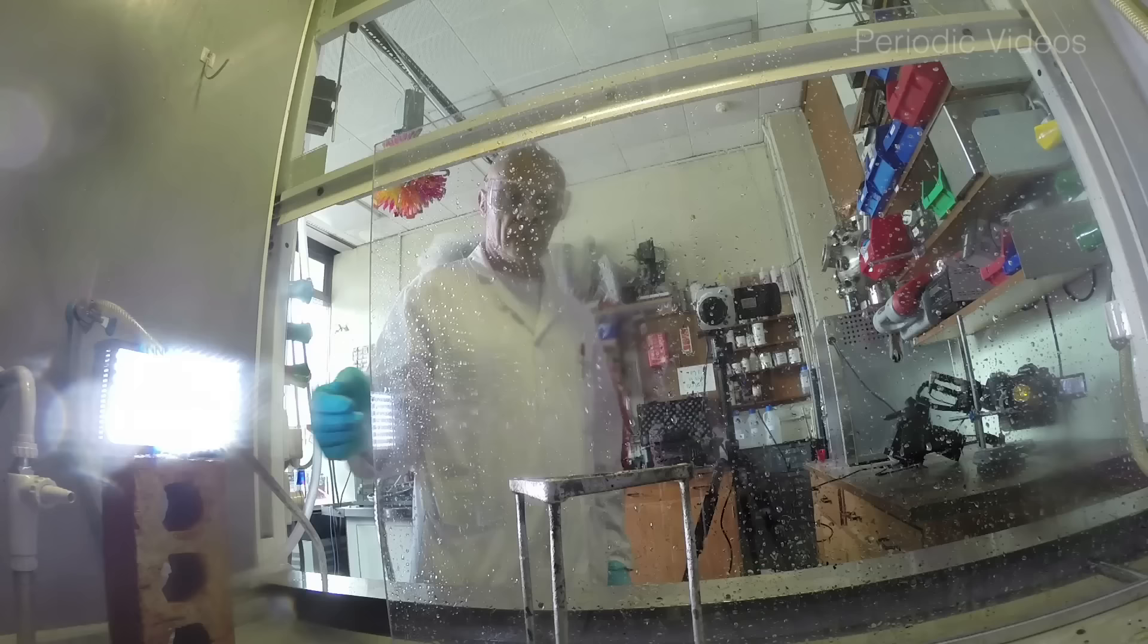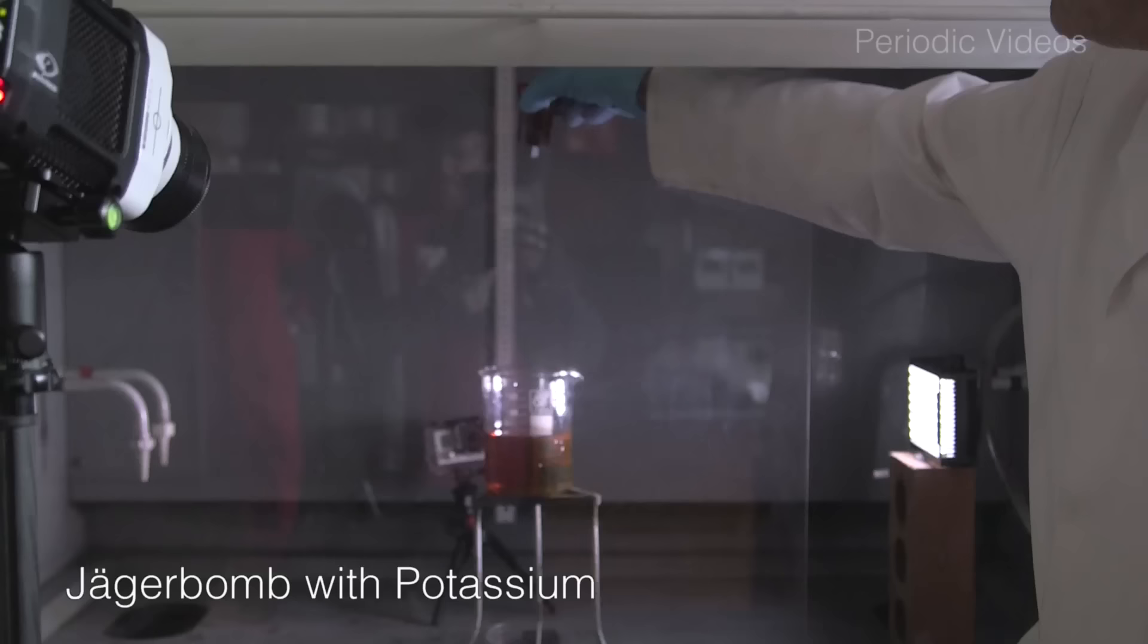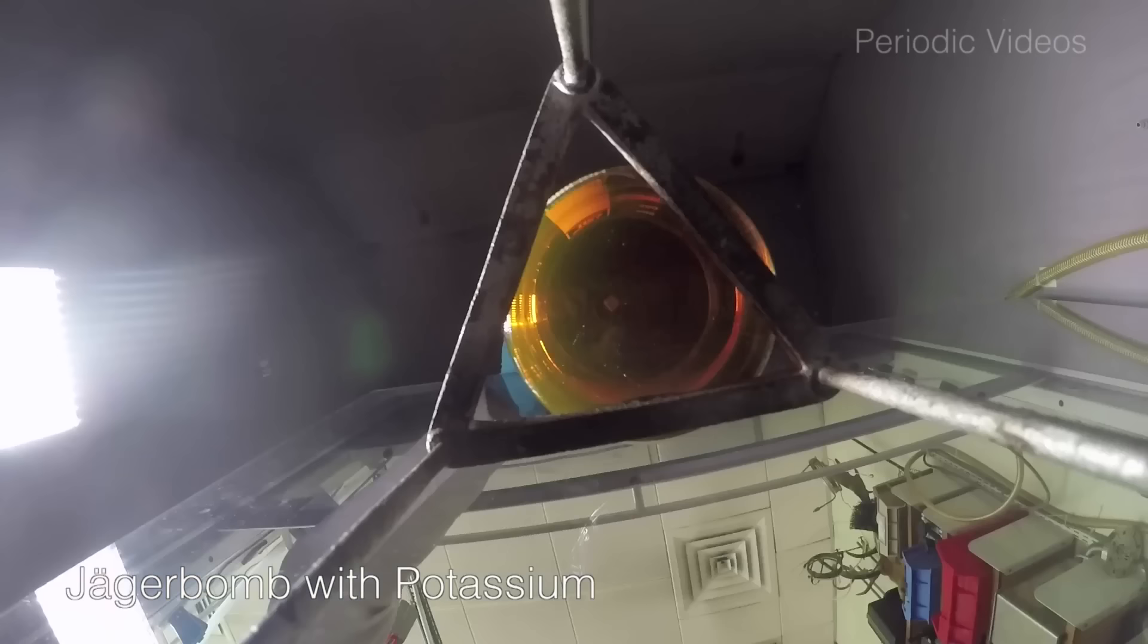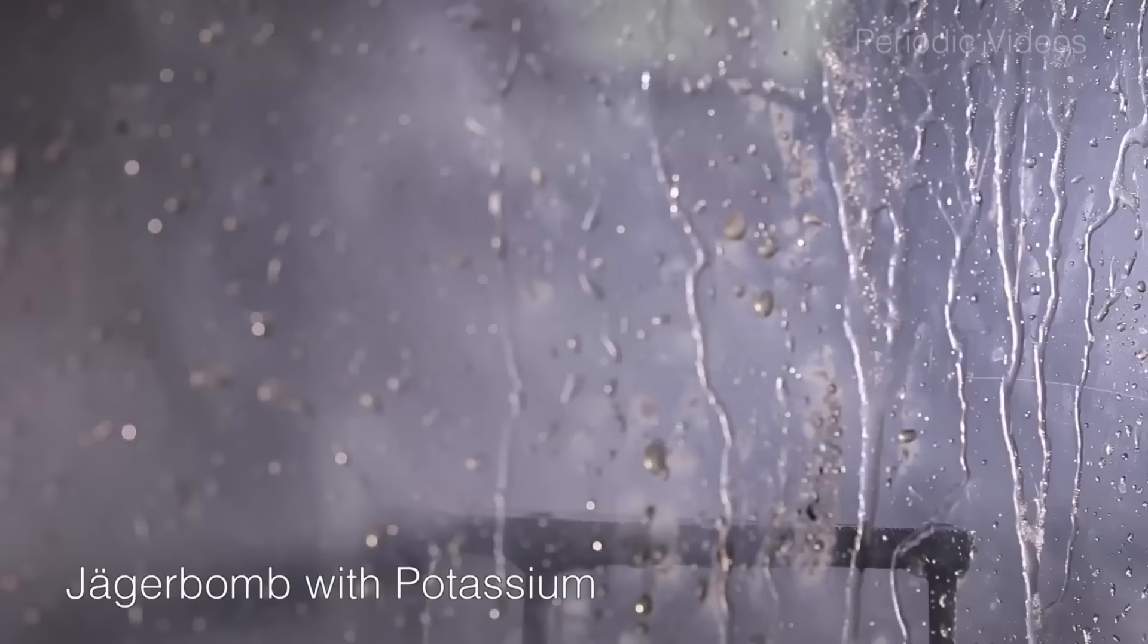Being a glutton for punishment, Neil cleaned up the fume cupboard and we tried a third experiment, which again went with a really quite satisfying bang. Okay, Neil.